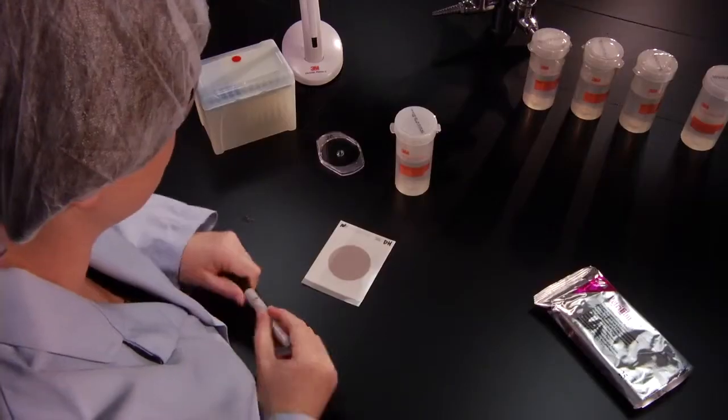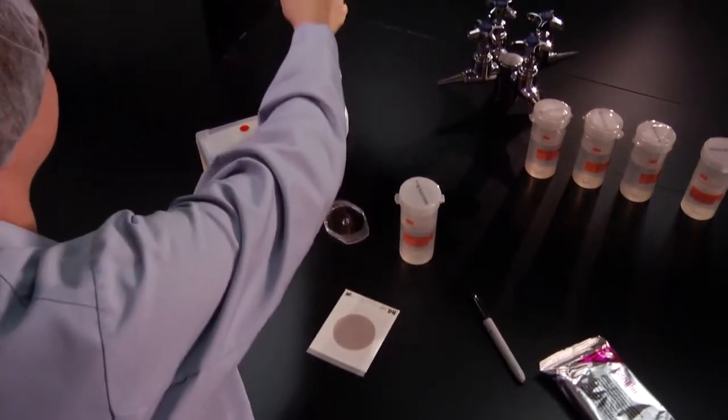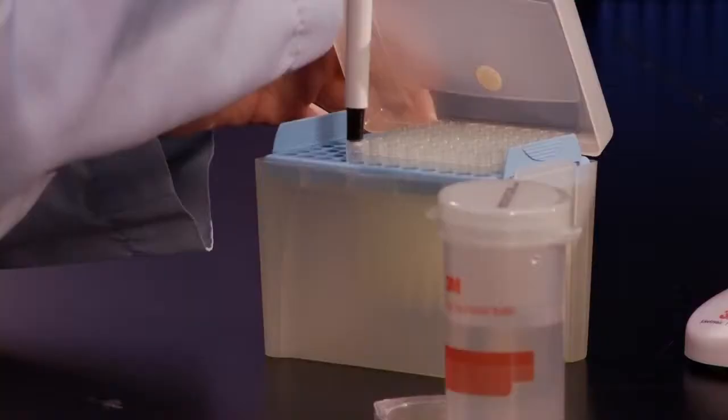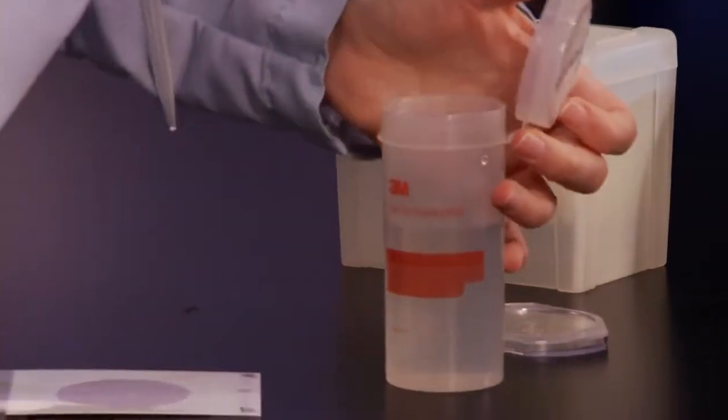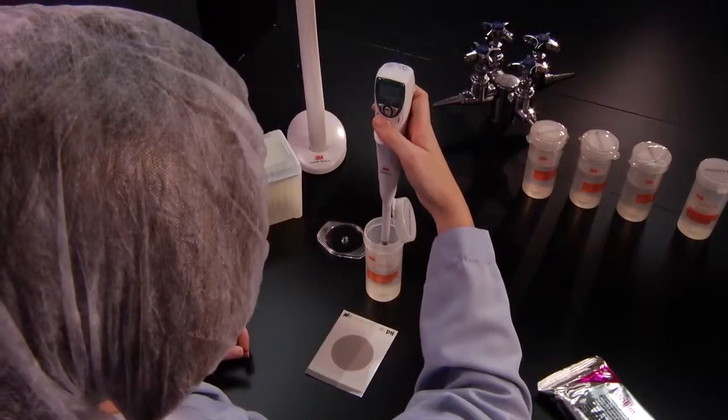Then attach a tip to your pipetter. We're demonstrating with 3M's 1 milliliter electronic pipetter and tips, a pre-programmed instrument for diluting and pipetting onto 3M PetriFilm plates.